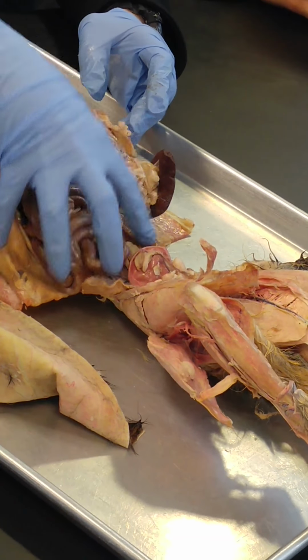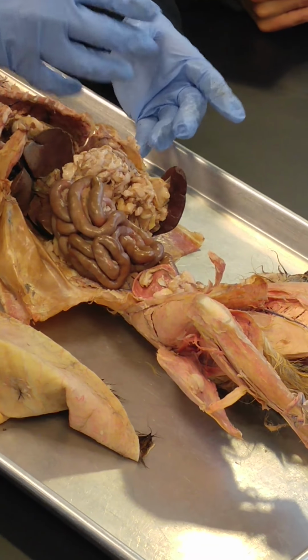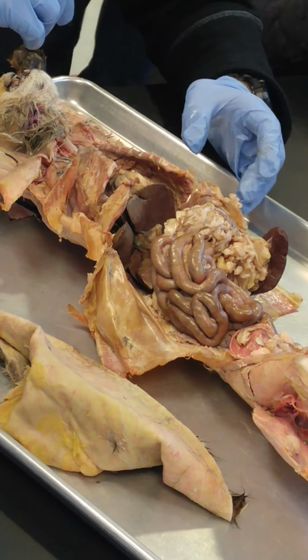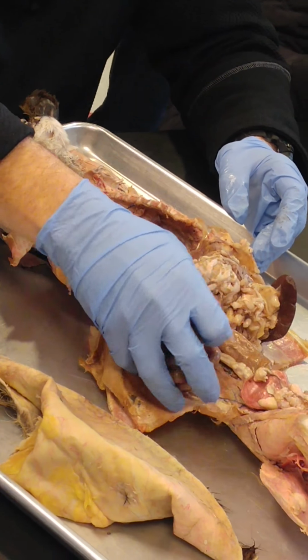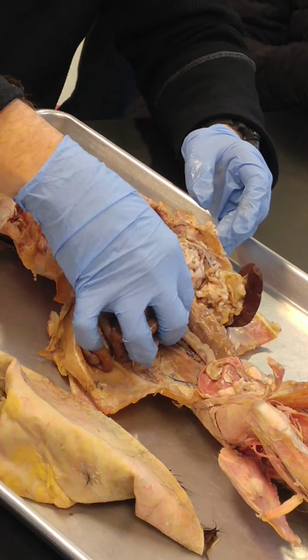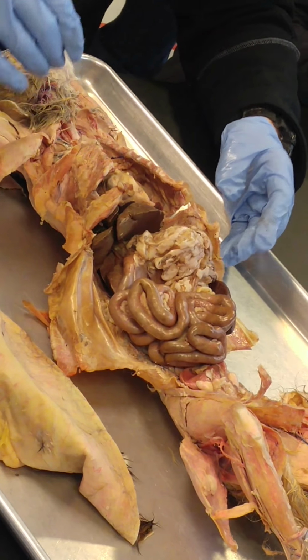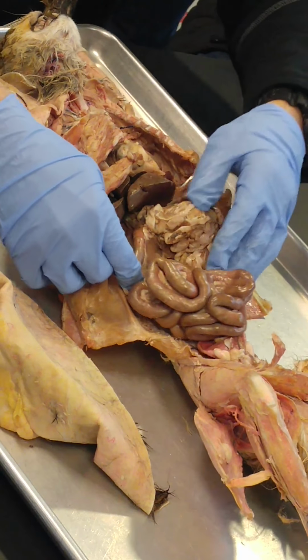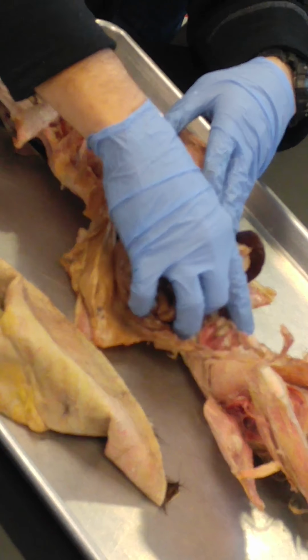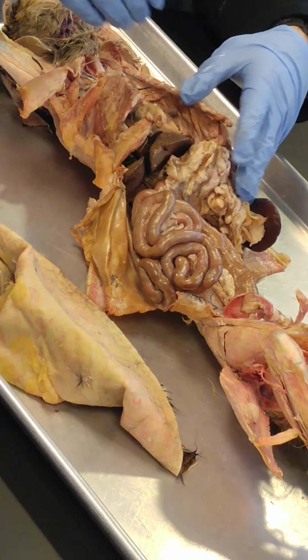Remember, we're dealing with a dead structure. In living tissue, this is going to be constantly moving. We know that because if you listen to your bowel sounds, you're going to hear sounds in your stomach, you'll hear sounds in your small and large intestine, because these are constantly moving. But in these dead animals, of course, it more looks like a straight line, doesn't it? But it's not. It sits like this in living tissue, more like a question mark. So again, cecum the first part, ascending colon there, transverse colon, descending colon here, sigmoid colon kind of in this spot, and then rectum and anus. Rectum is the lower part. Anus is where it transitions to the outside environment.